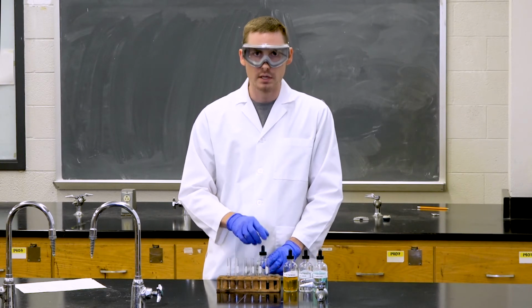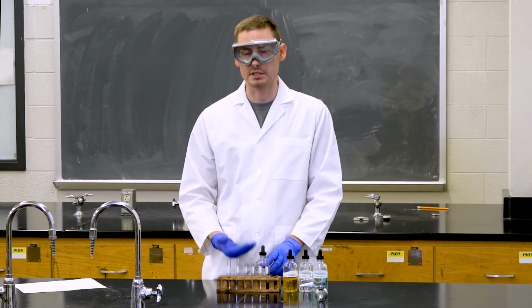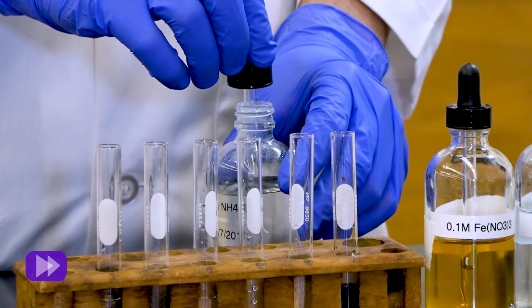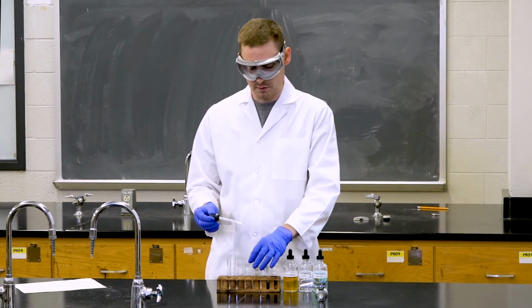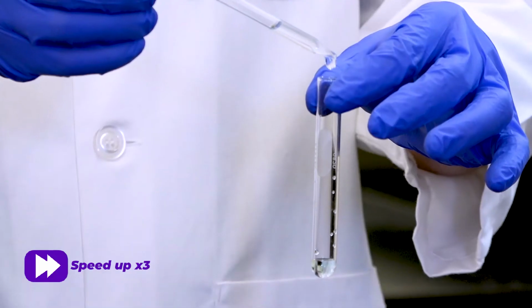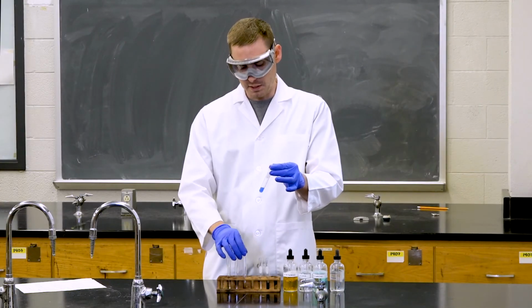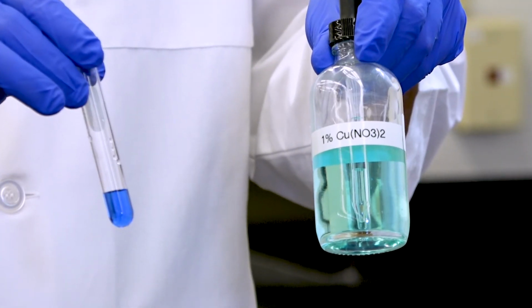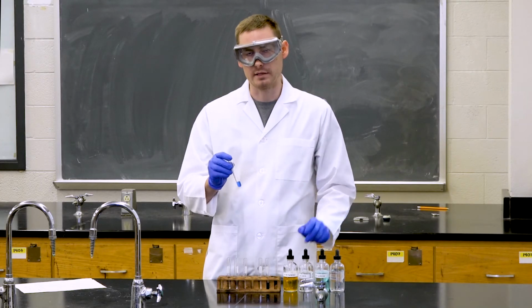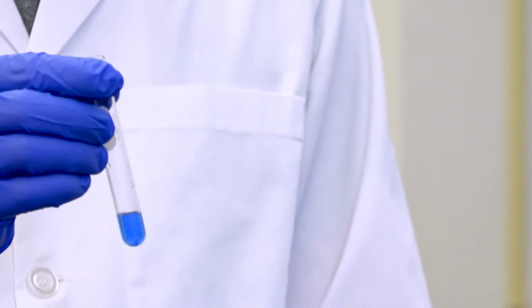This reaction will produce an odor, an ammonium odor, because ammonium hydroxide is just ammonia dissolved into water. So we can now add it to our copper solution, and we will observe the color change that happens. As you can see, as compared to the distilled water negative, we have a much darker blue solution than we began with in the copper nitrate when we added the ammonium hydroxide. Again, this is a color change of complexation. It's not a precipitate, so it would not fall out of solution as a solid.